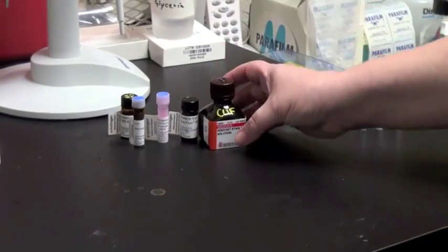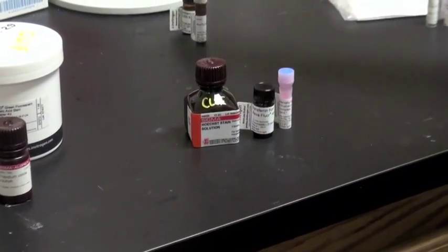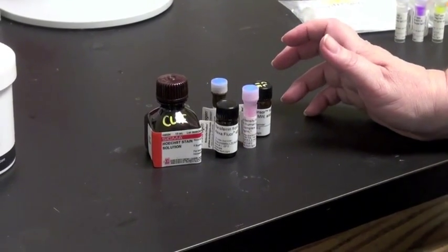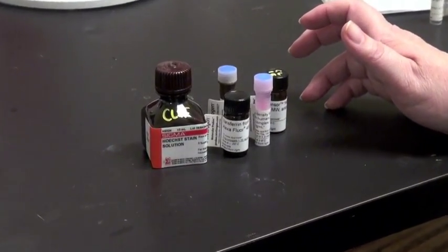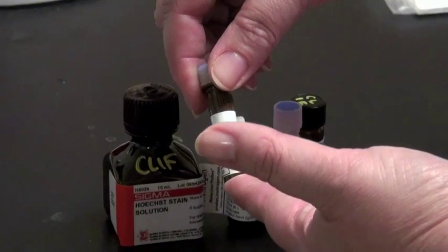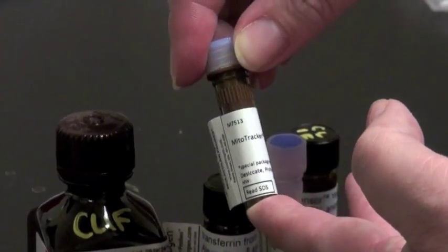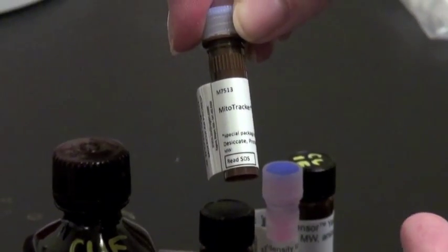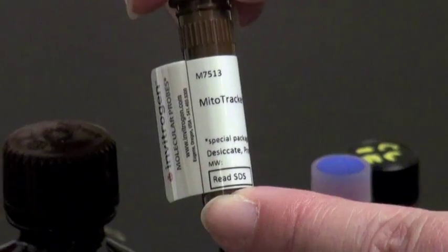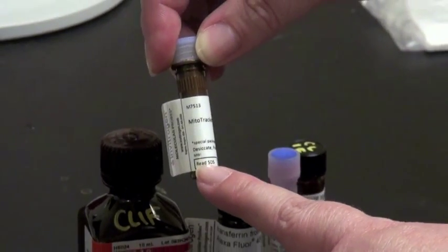In addition, for live cell imaging there are a number of wonderful options for staining different organelles. All of these require you to read the manufacturer's instructions very carefully. For example, MitoTracker Red, which is a red dye that stains the mitochondria, needs to be taken up into the cells for a period of time before imaging begins — about a 30-minute incubation. There are other manufacturer rules that are important, such as not having serum in your media, as extra lipoproteins in serum can bind up the stain.